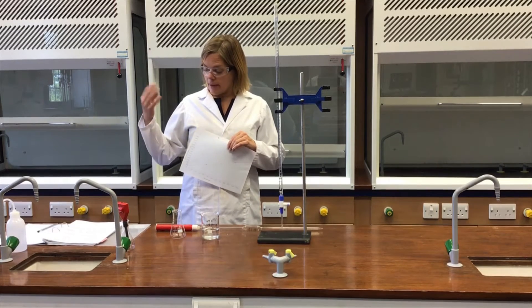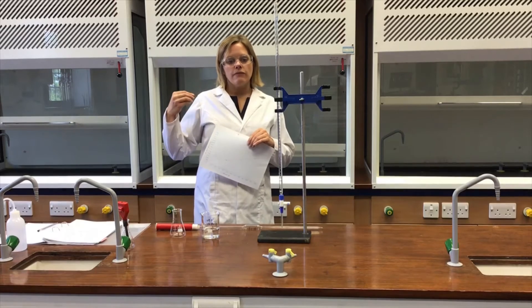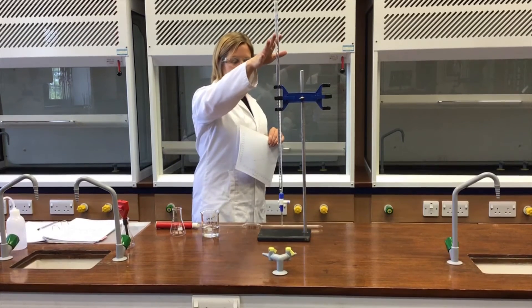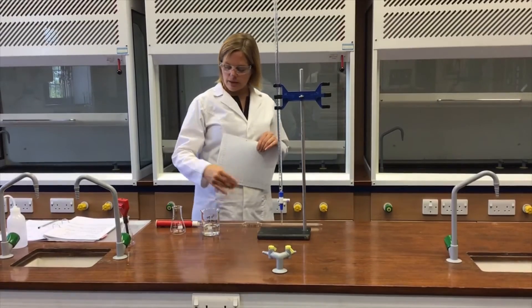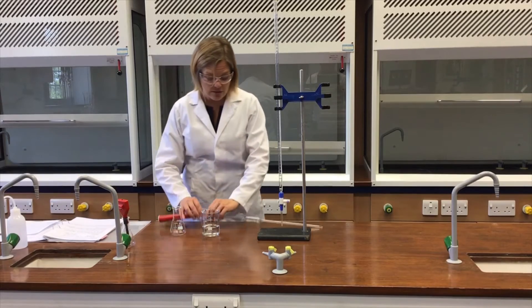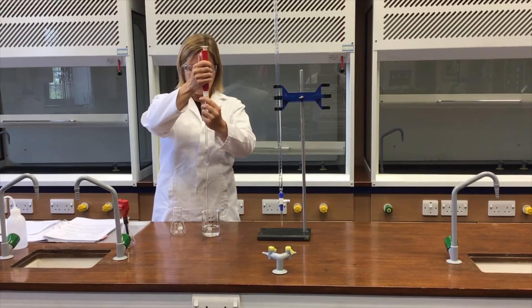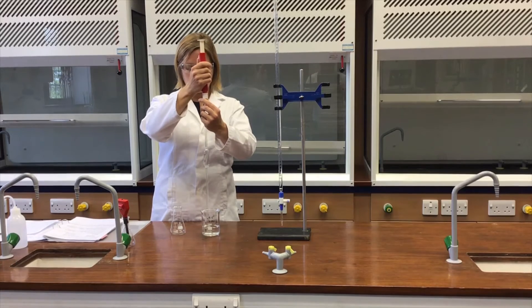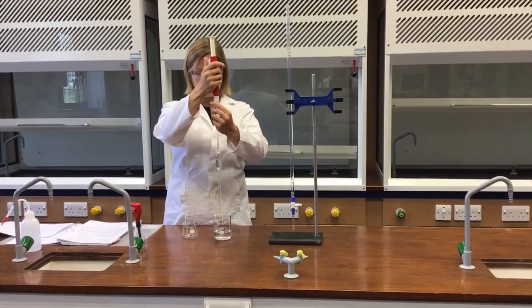The second aspect — part 3 of the practical — is to investigate the effect of adding hydrochloric acid, which I've got in this burette, to some ammonia solution which I've got in the beaker down here. I'll use the same method. I've already rinsed this pipette with the ammonia so we're good to go. Safety filler's on, I'm filling it, just slightly overfilling it so I can get my thumb in place without losing too much solution.